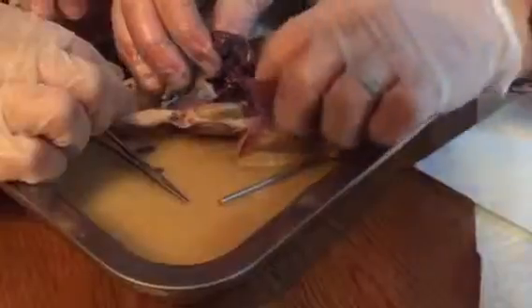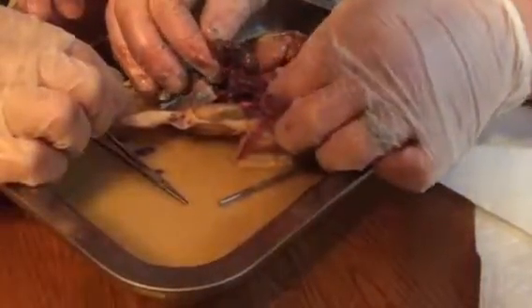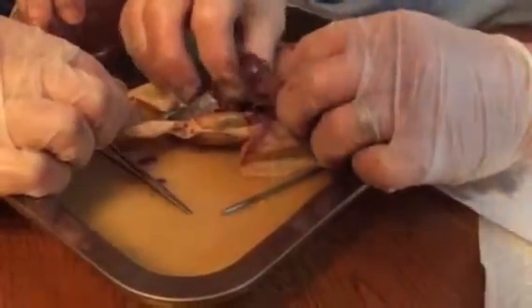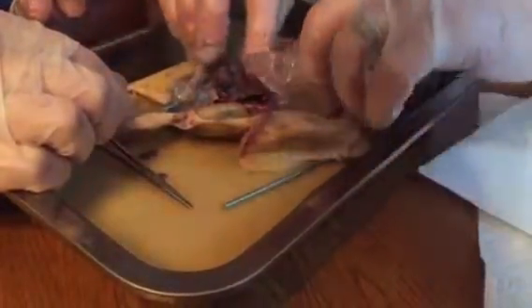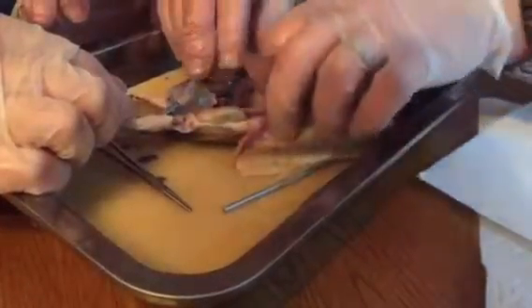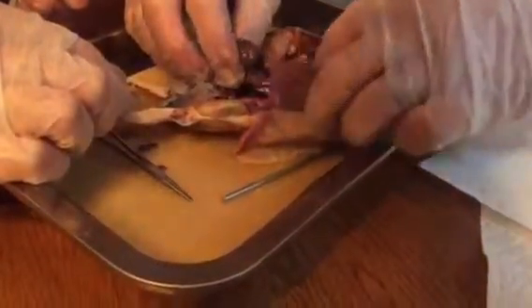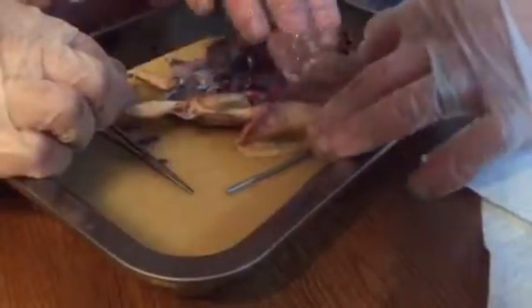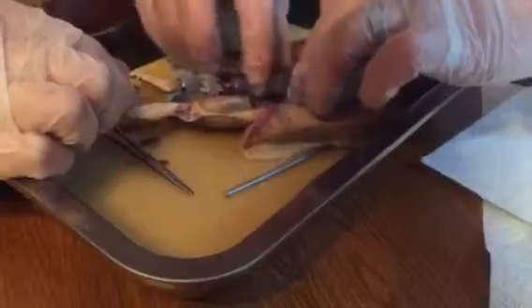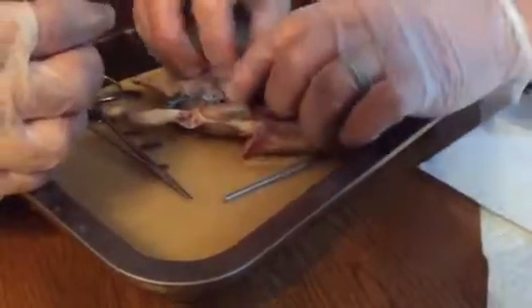Then that's interesting how it comes across like there. That's the omentum. See that? It has veins and arteries in it, and it holds the intestine together, but it allows it to flop around in there. And then you had the splenic flexure, which is the turn right by the spleen, which is right there. The hepatic flexure is the turn right by the liver.